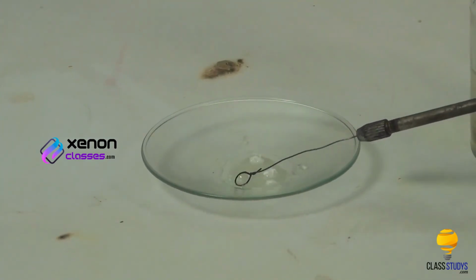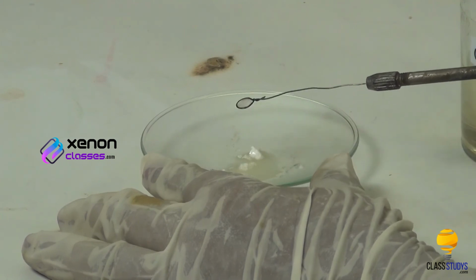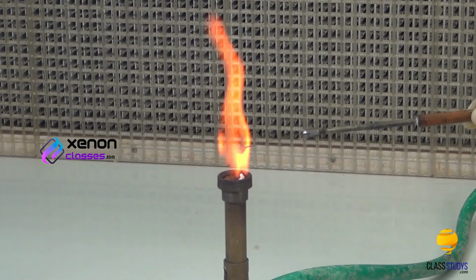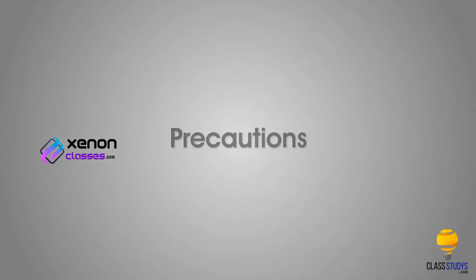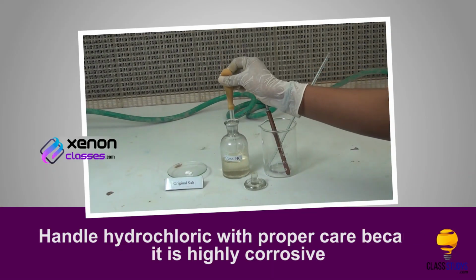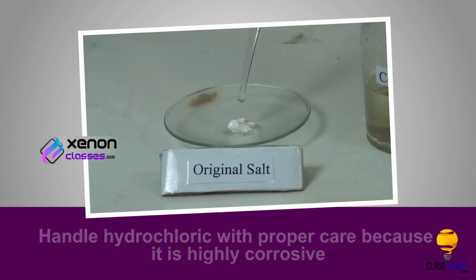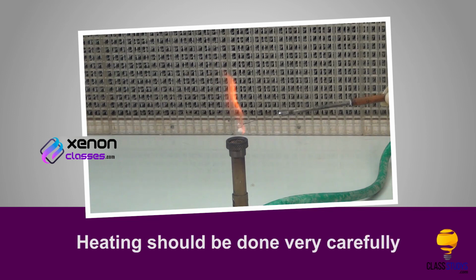Take a small amount of the paste on the platinum wire loop and introduce it into the oxidizing flame of the Bunsen burner. Brick red flame indicates the presence of calcium ions. Precautions: handle hydrochloric acid with proper care because it is highly corrosive. Heating should be done very carefully.